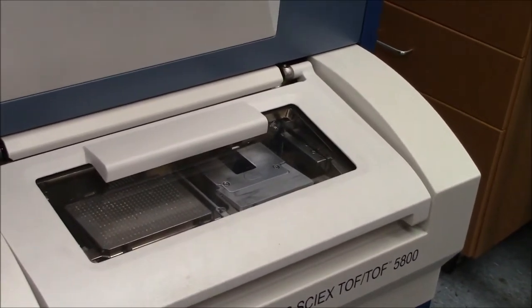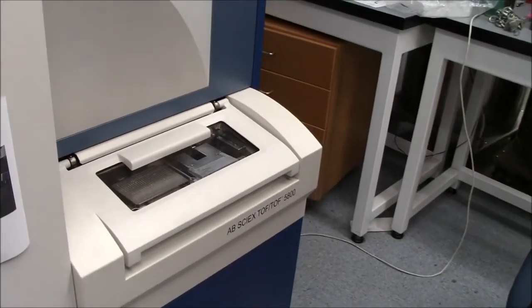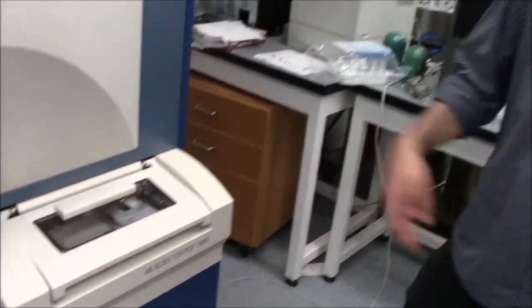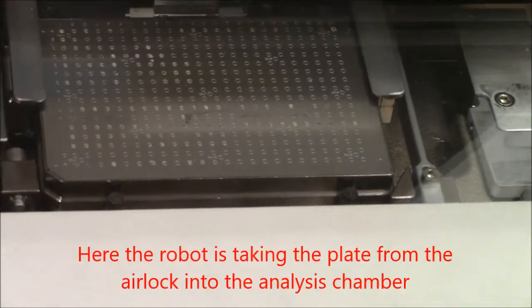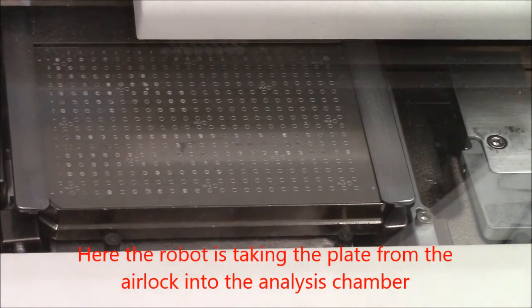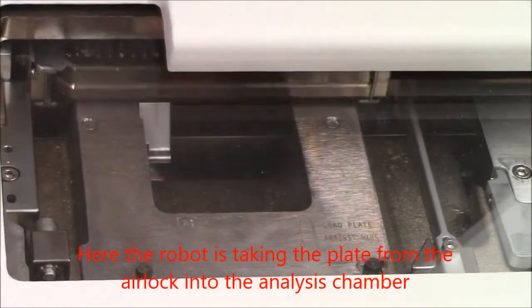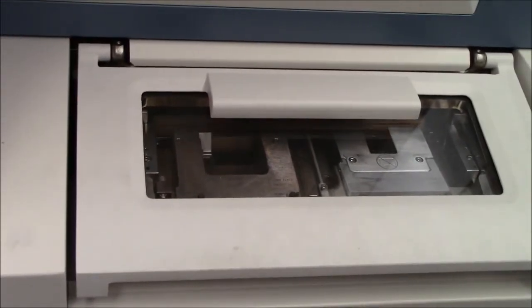There's two vacuums. There's the source vacuum, which is like negative eight torr or so. And then there's the analyzer vacuum, which is the vacuum that the TOF is at. And that's about negative nine. So there will be two separate turbos for it. So we make sure we maintain really good rough pumps. And we make sure we change the oil frequently on the roughing pumps, so the turbos don't have any air resistance when they spin.